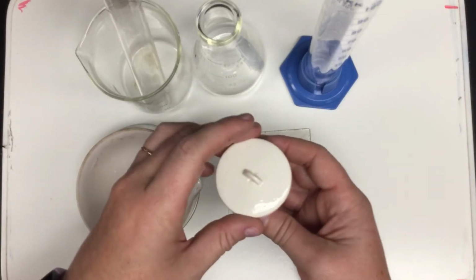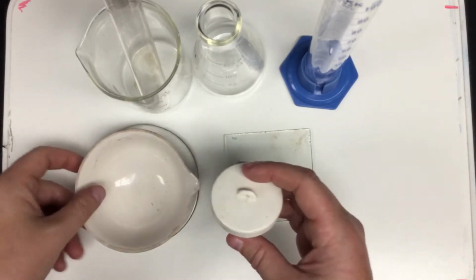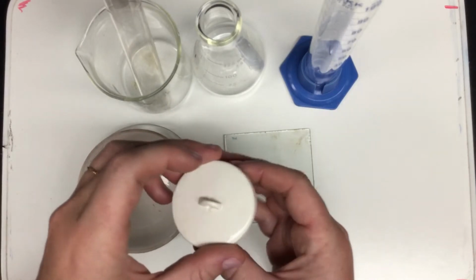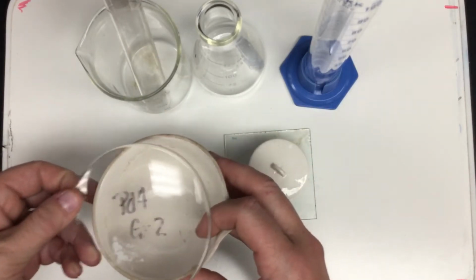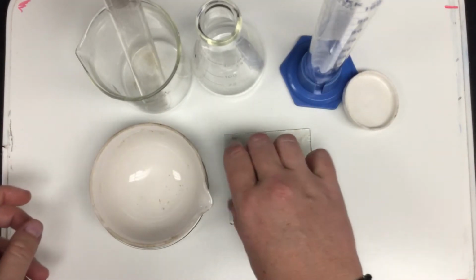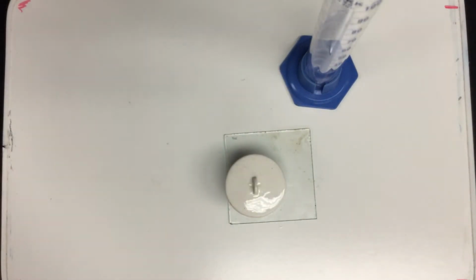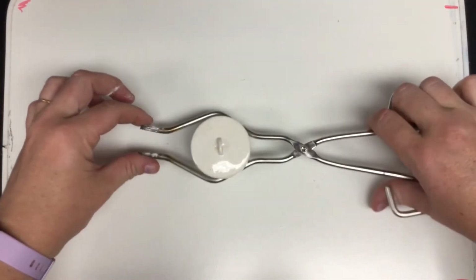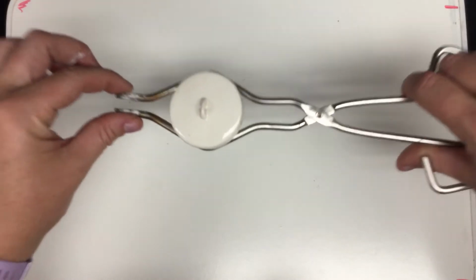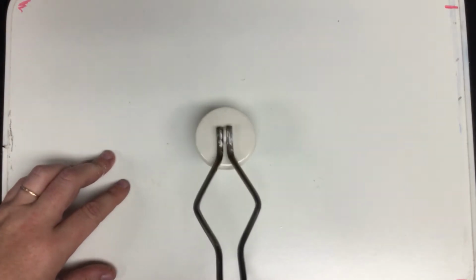We also have our crucible and our cover, and the crucible and cover is also used for heating things. Big difference, of course, is size and the fact that the crucible has a cover that fits it very well, whereas the evaporating dish, we often just use our watch glass as the cover. If you are using a crucible, it's important that you know the other equipment that goes with it. So if we look at our crucible and cover, you will also have crucible tongs. The crucible tongs fit around the crucible. It cradles it within this larger area, and it can also be used to hold the lid.